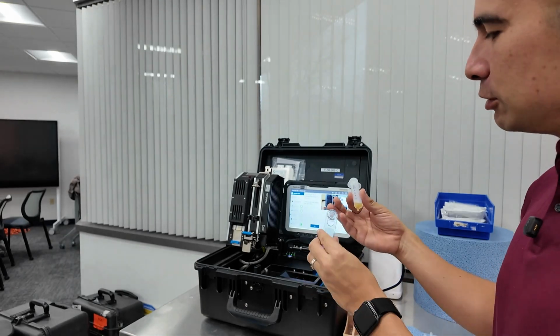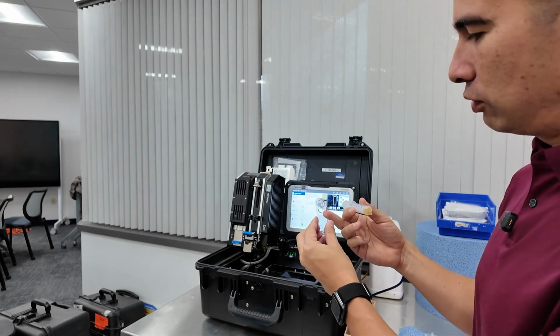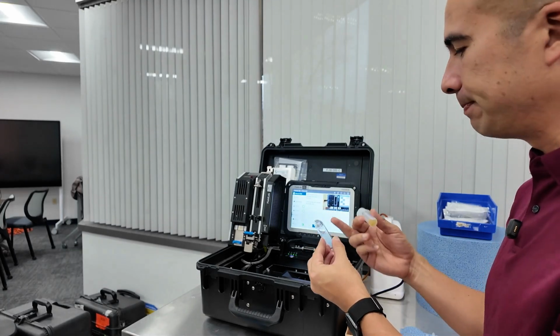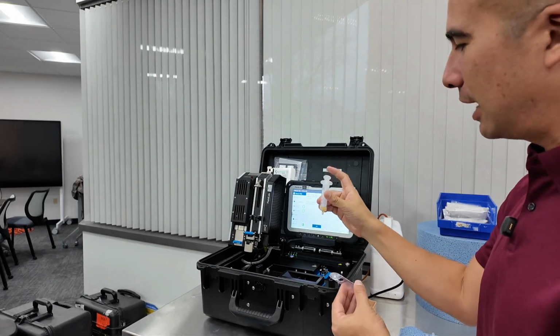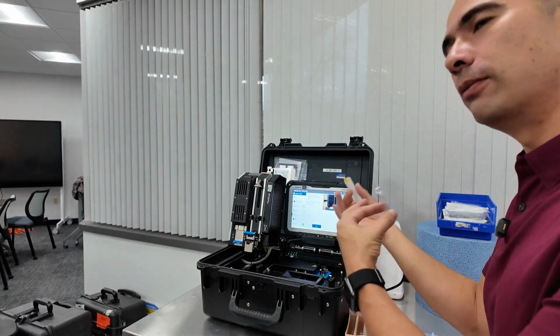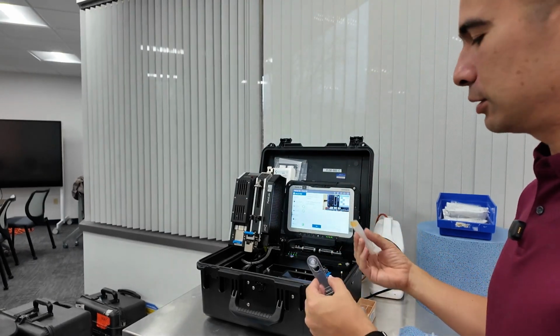The pore blockage method relies on us pushing a syringe of oil through this filter patch, which is a 4 micron membrane. And then it's going to look at the pressure buildup as this syringe forces the oil through it. Based on that, we can get a calculation of the 4, 6, and 14 particle counts.